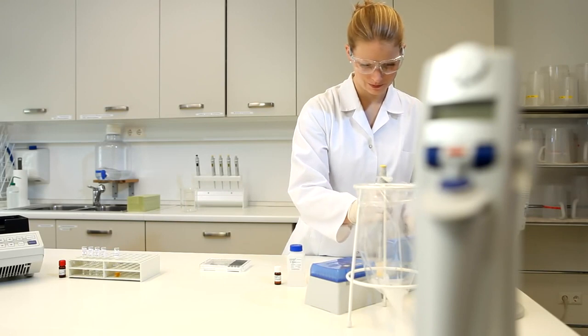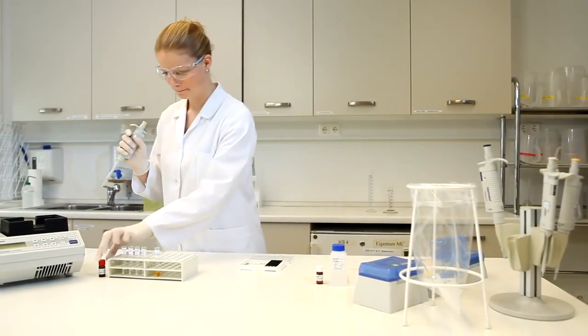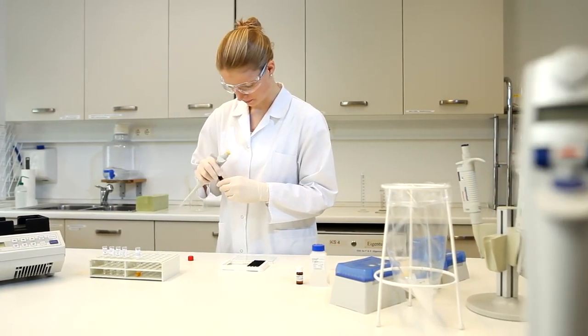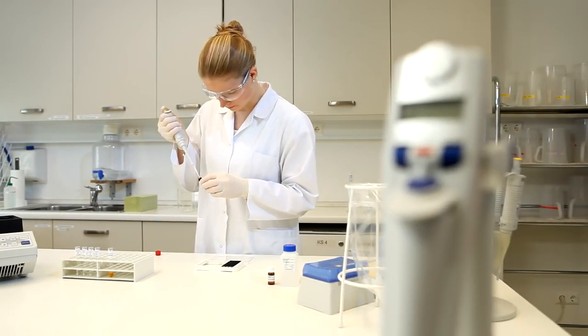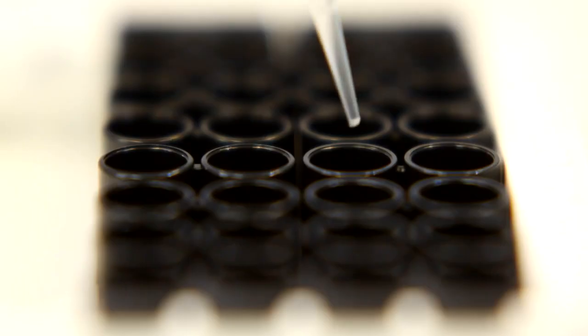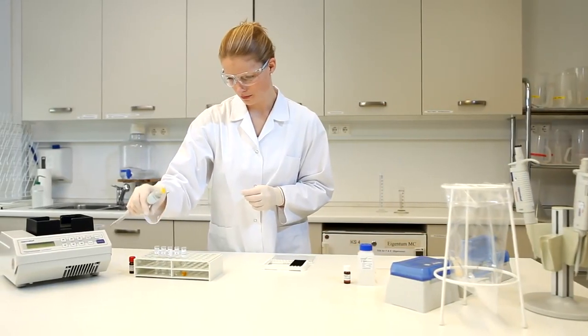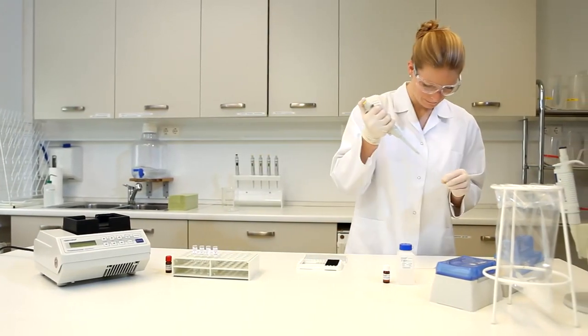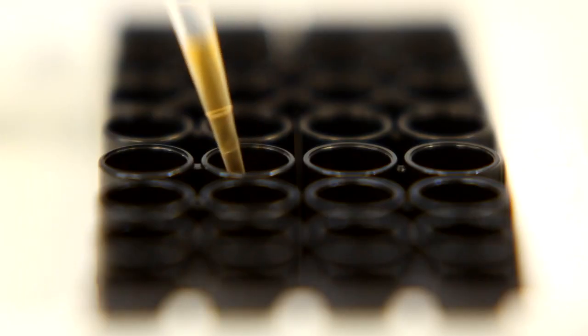Pipette 100 microliters of each preparation into their respective wells. Duplicate determinations are recommended. Add the standard dilutions, blanks, and samples.